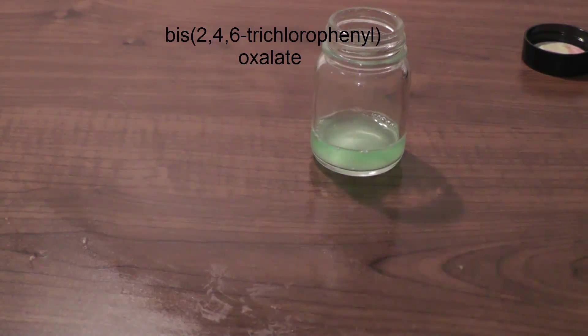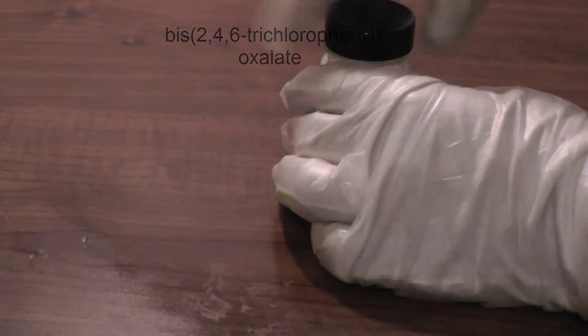Now you need to add TCPO. This is what produces the chemical energy at the heart of the reaction.